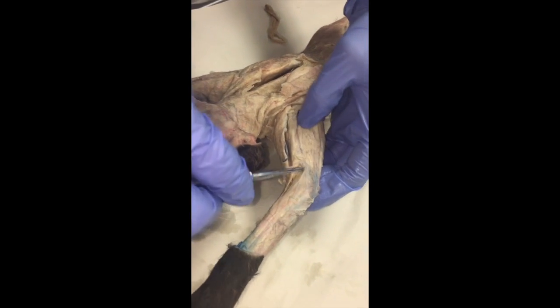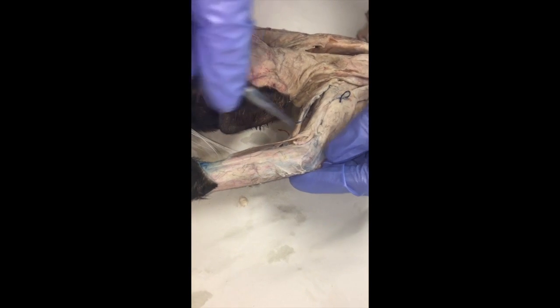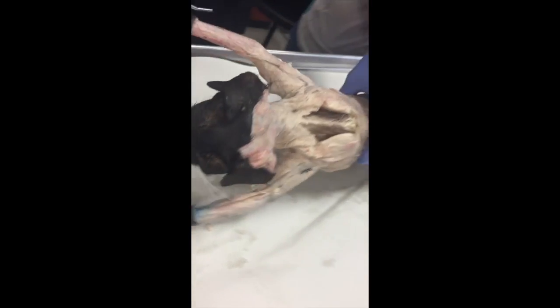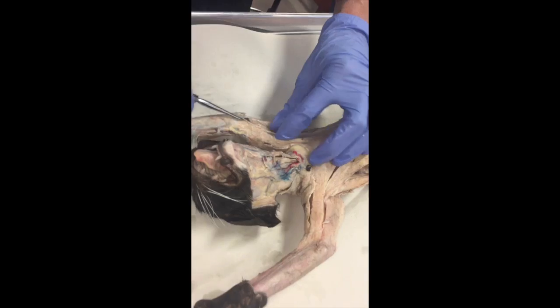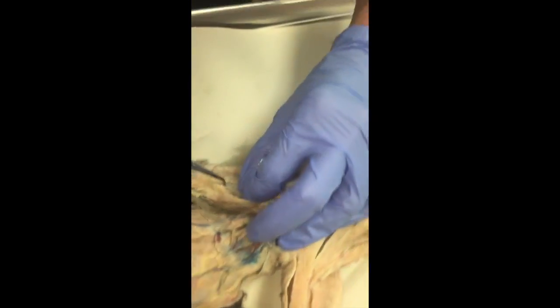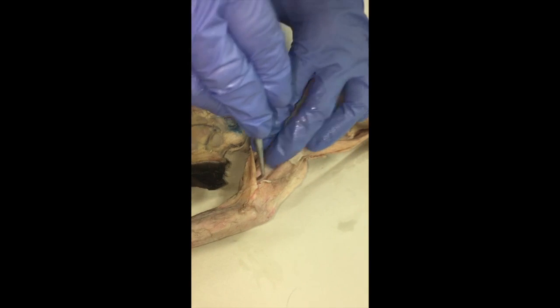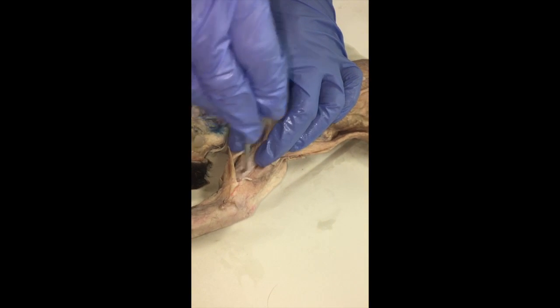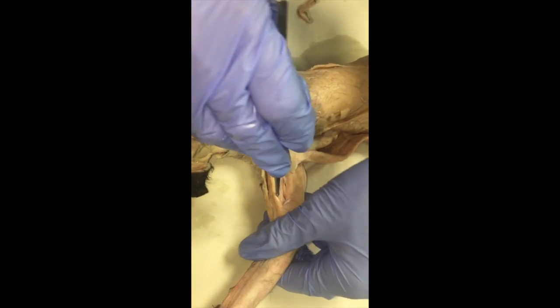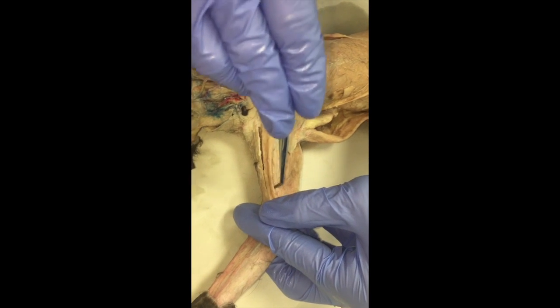Turning back to the front, we have the epitrochlearis, which is this thin little muscle right here. It's called epitrochlearis because it ends right around the trochlea of the ulna. Then we have the brachioradialis, which is on the back. It runs up into the forearm — it's the only muscle you'll see running up into the forearm, coming from the brachial region along the radial bone. And the one I missed was biceps brachii, your biceps curl muscle, which is anteriorly in the same place where the brachialis is posteriorly. I'll pull this down and pull the pectoantibrachialis aside — you can see it right here.